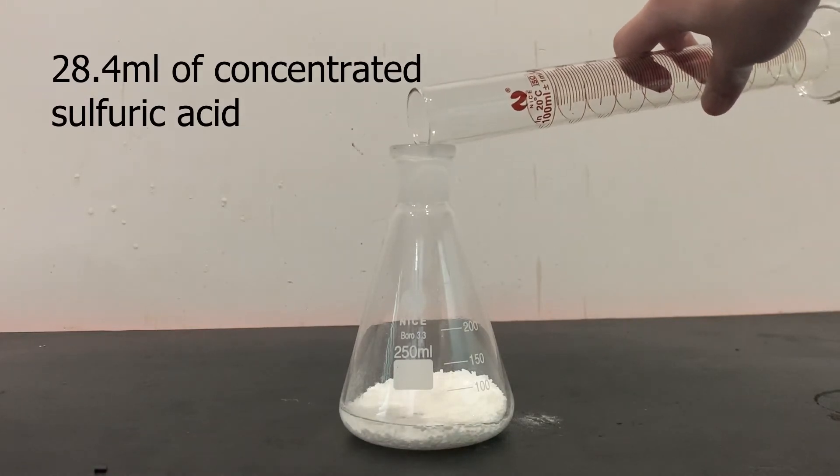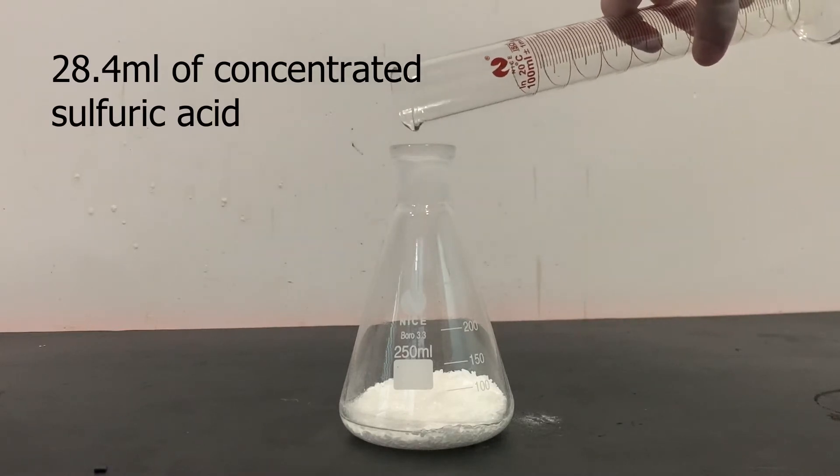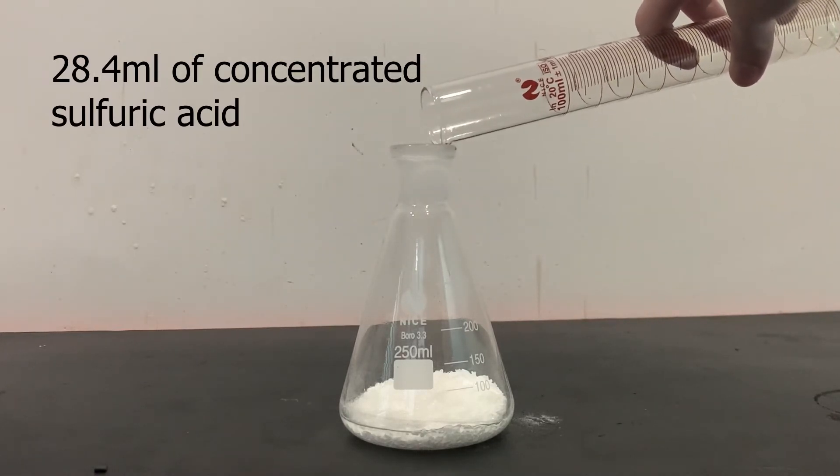Also, don't be like me and not wear gloves when handling corrosive acids. You should always wear gloves when handling chemicals with only a few exceptions.